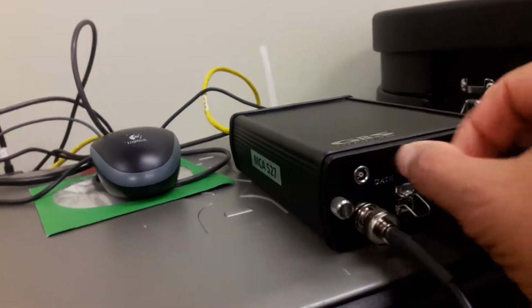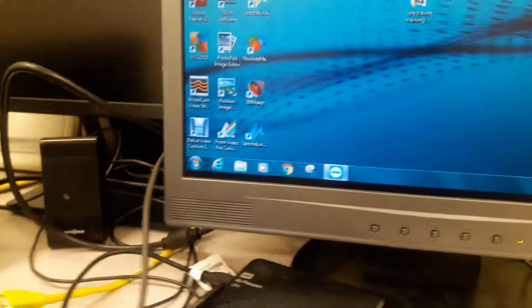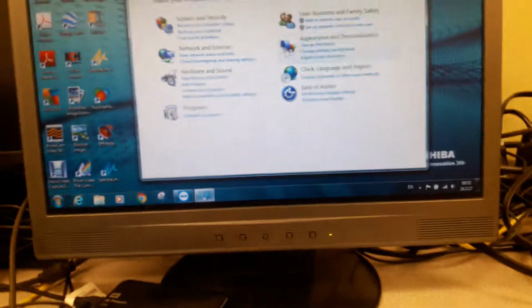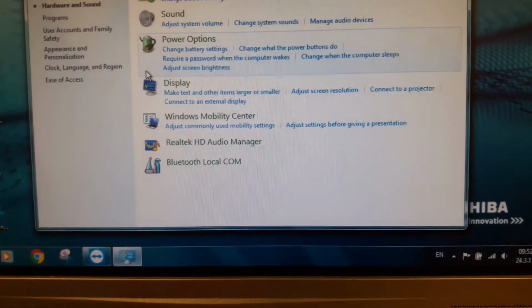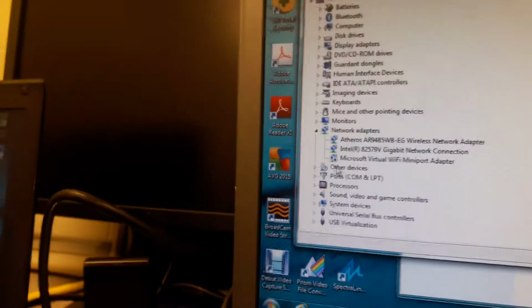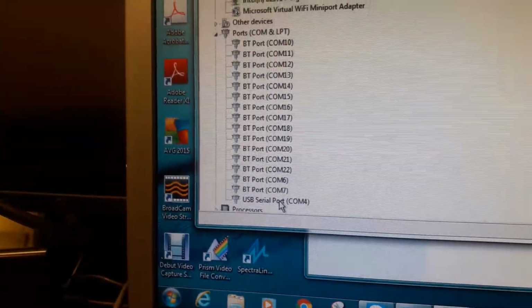So here we will demonstrate to you, we've turned on the unit using the toggle switch in the front, from the off to the on position with the green light flashing. And what we do is we confirm the connection by going into our device manager. If you're using Windows 7 Professional like we are here, or Windows 10, you should be able to find device manager under the control panel. And we can show you under ports that this device is connected to COM4.